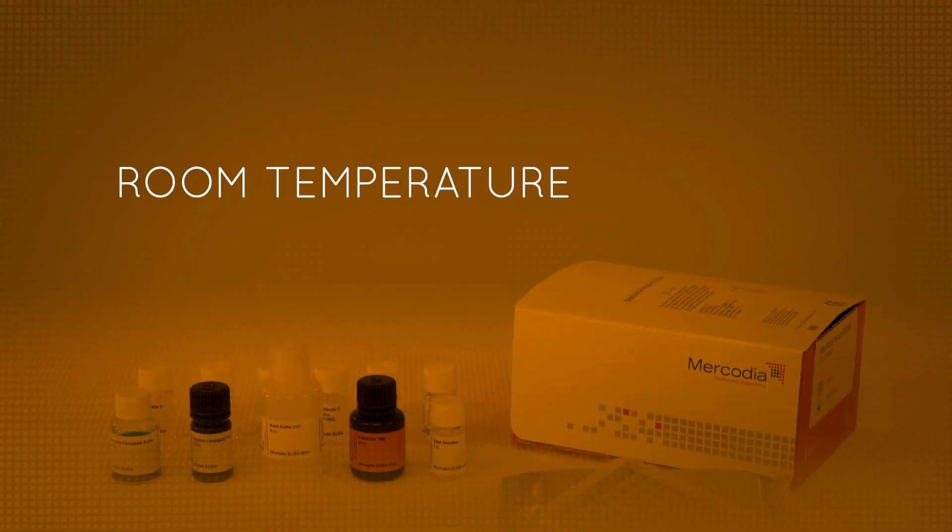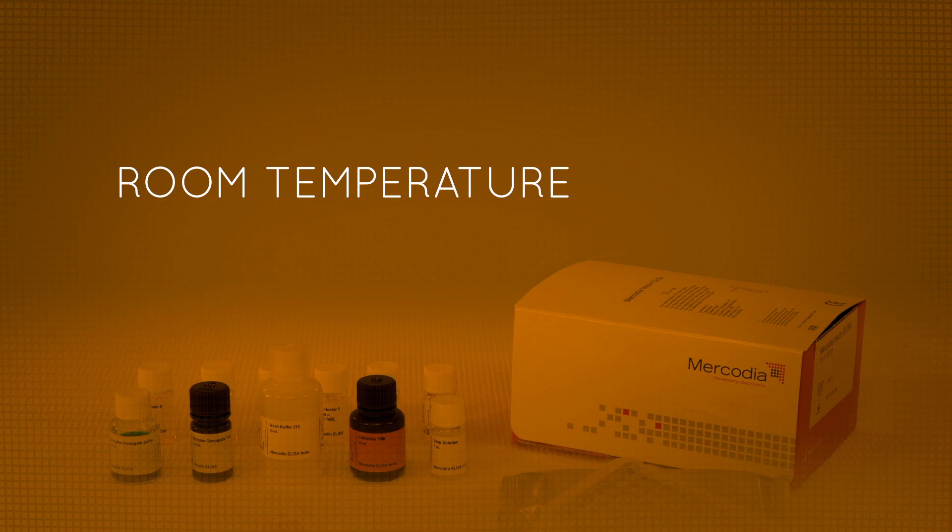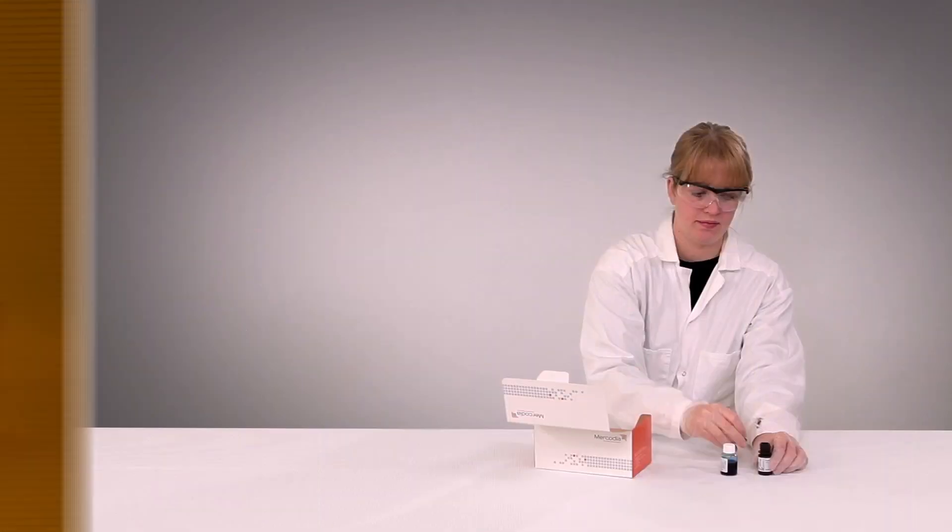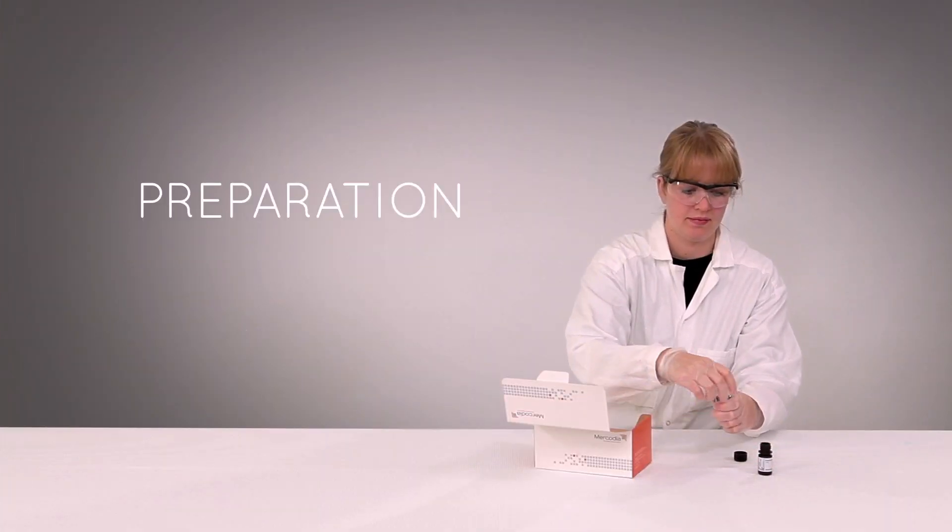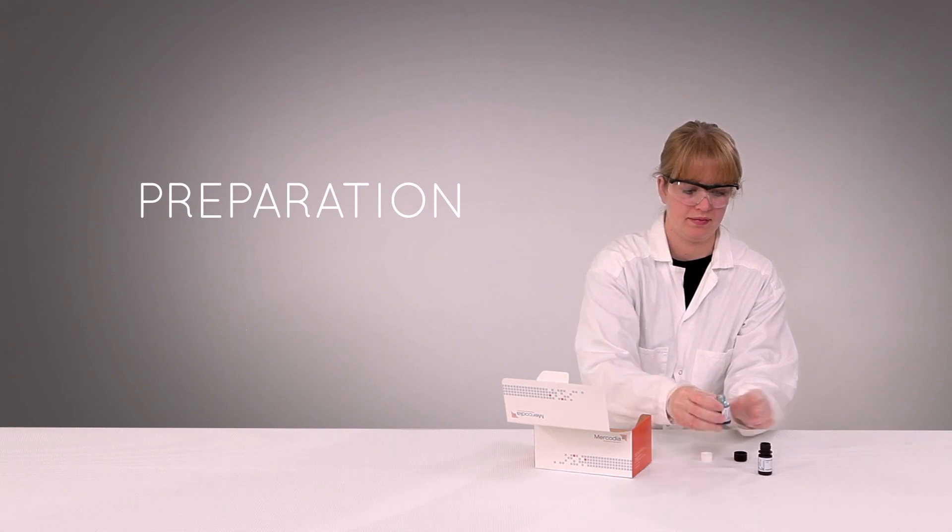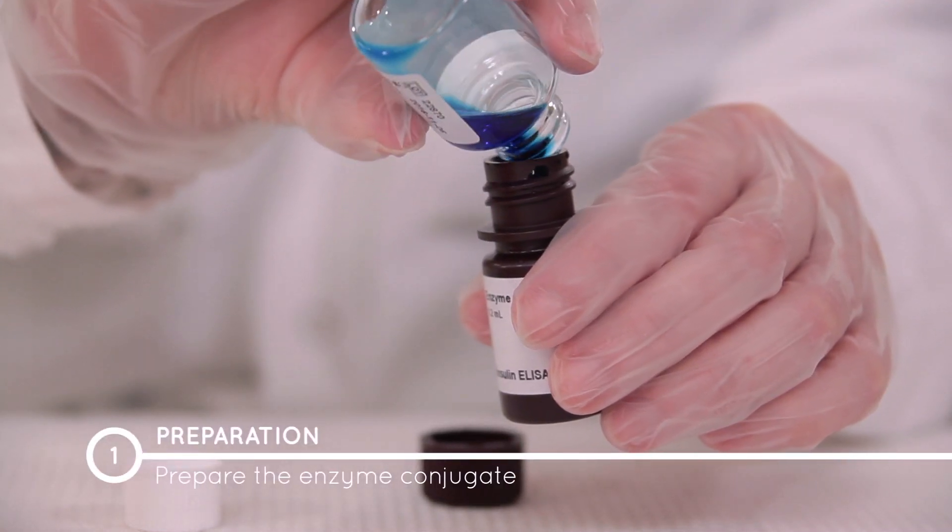All reagents and samples must be brought to room temperature before use. First, prepare the enzyme conjugate 1X by adding the enzyme conjugate buffer directly into the enzyme conjugate 11X vial.